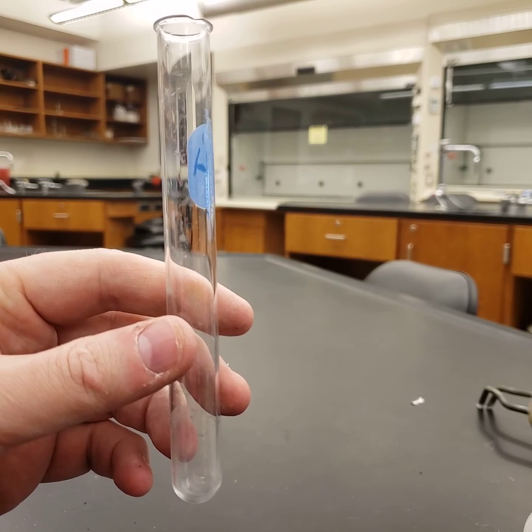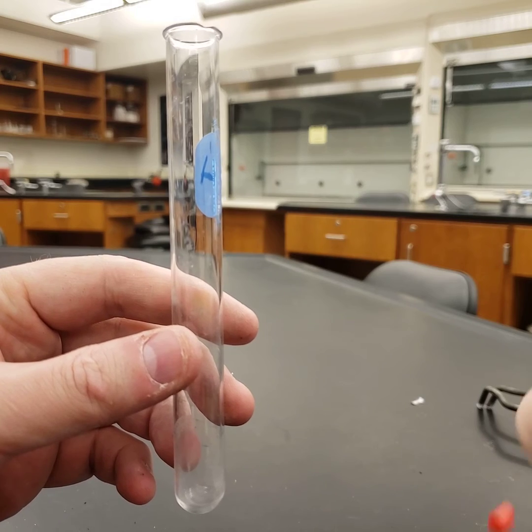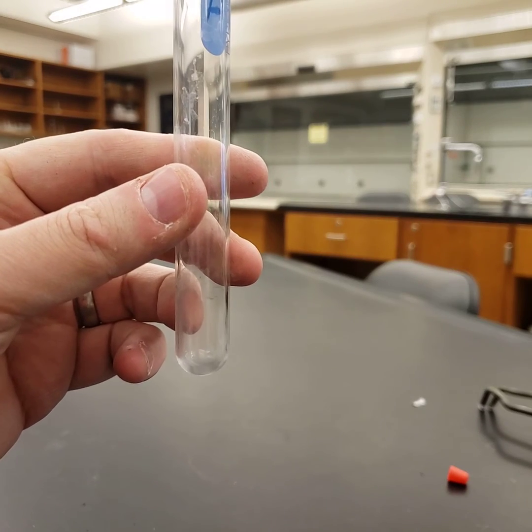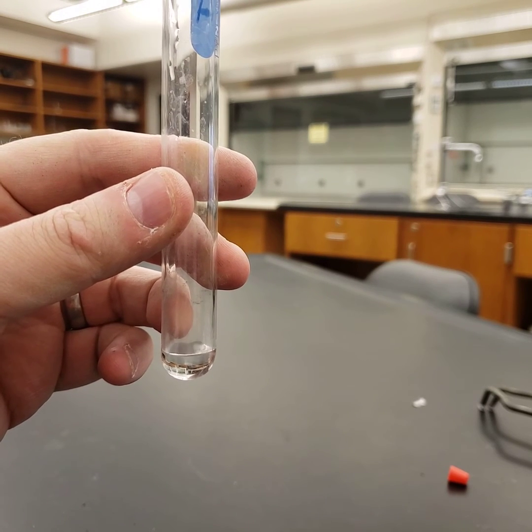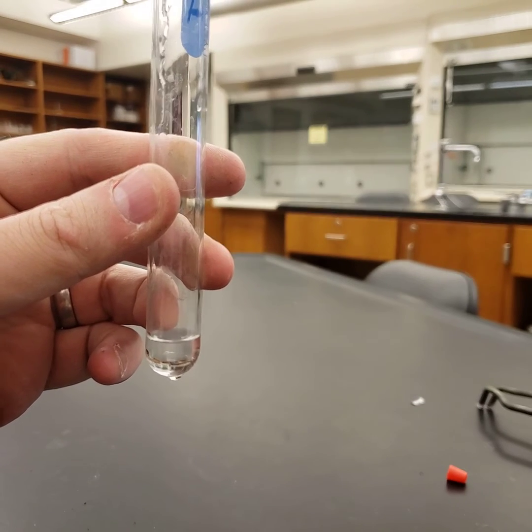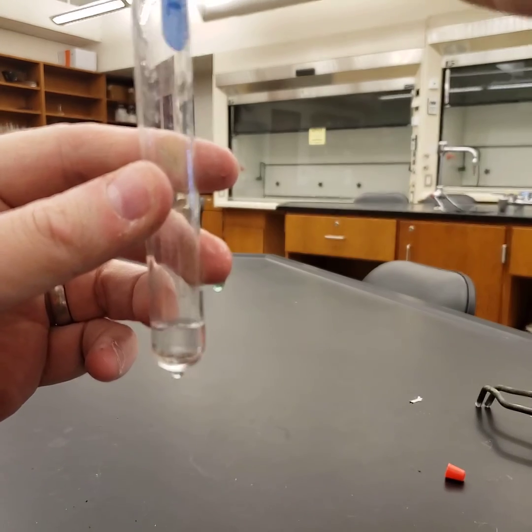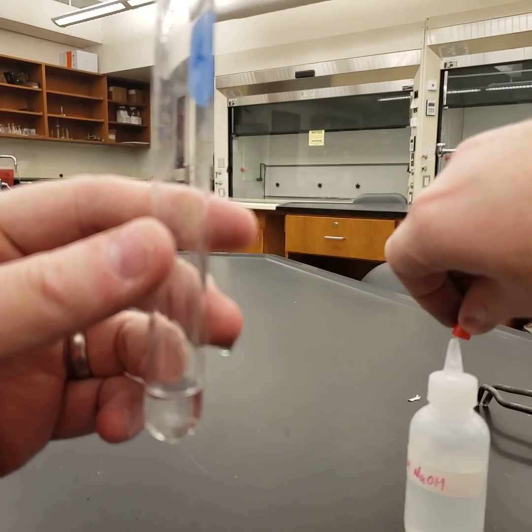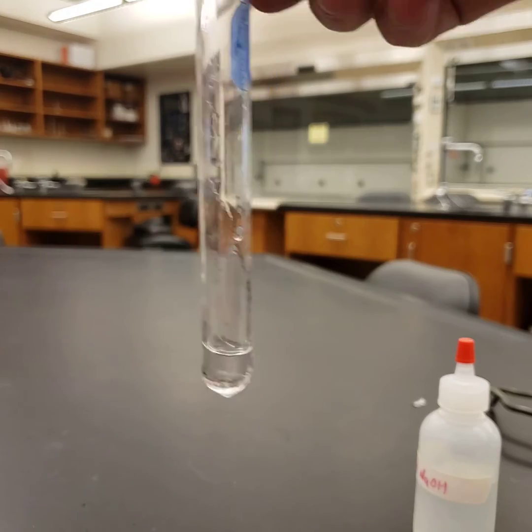For this experiment, it's the reaction of zinc acetate with sodium hydroxide. We're going to put a small quantity of sodium hydroxide — this is a dilute solution so it's not dangerous — a small quantity in there. Again, it's diluted so it's not dangerous.